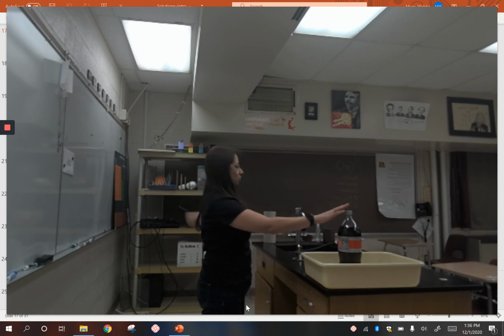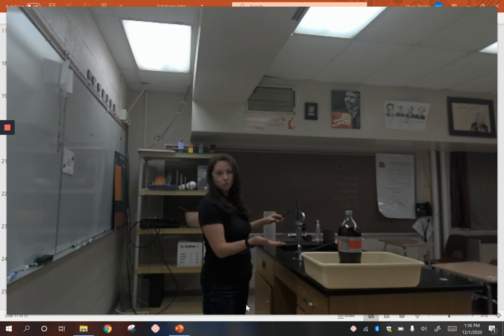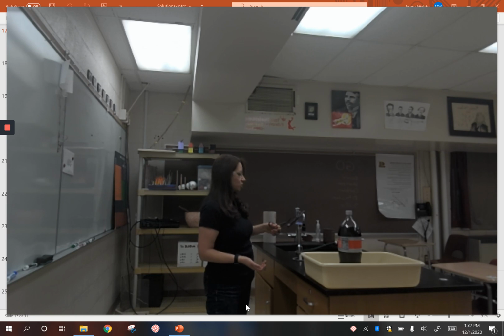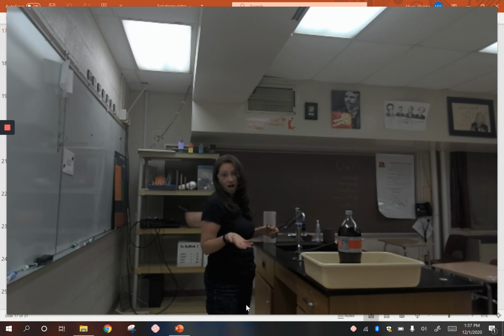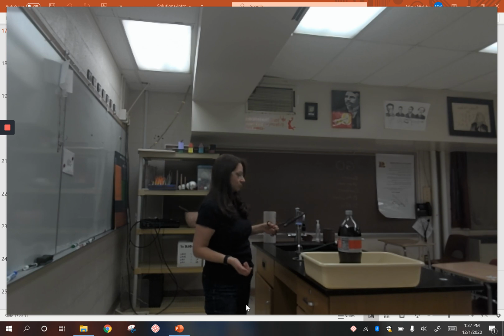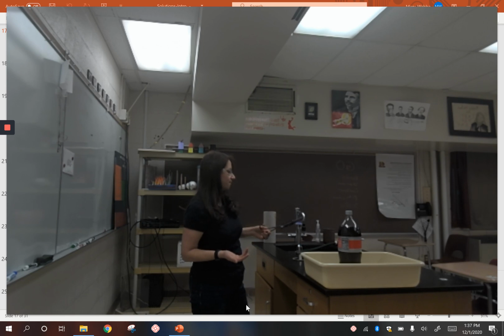And I have a 2-liter Coke bottle here. It's about at room temperature right now. So I'm going to heat this copper rod for a minute or a couple of minutes, and we're going to open this and I'll put it in there and see how, when it gets hot, that affects the solubility of the gas inside. So soda is made up of mostly water and obviously carbon dioxide, which is a gas. And so we're going to look at the solubility of the carbon dioxide.